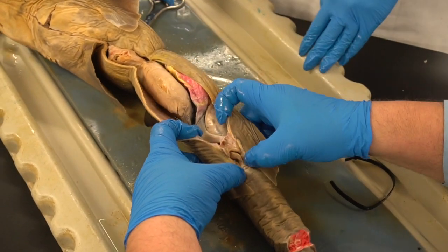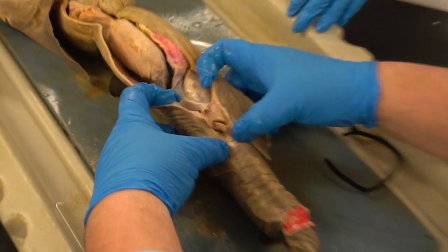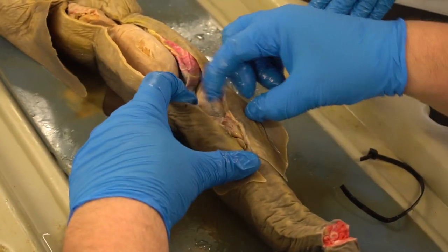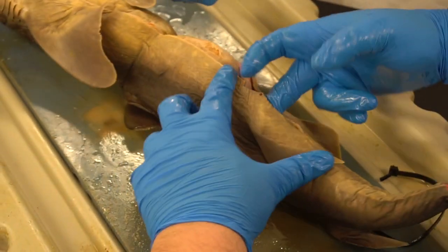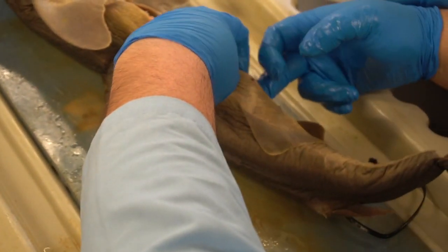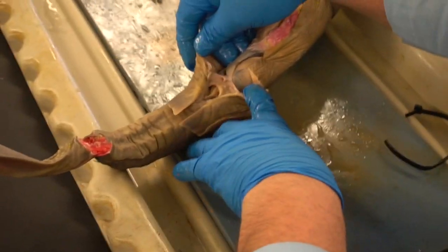I want you to be able to see the opening to the cloaca into the body cavity, and you can see how things come down into that cavity, so you can view them. Now for the reflecting flaps, we can go right in here, and you're just going to cut straight up to the top of the body wall. Now I want to keep this here so you can still see some of the connections, so I'm not going to go crazy with that.